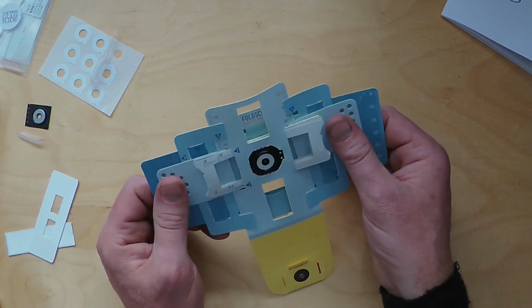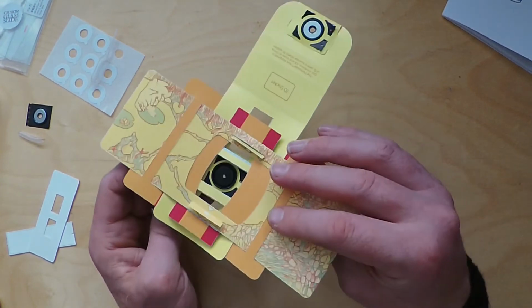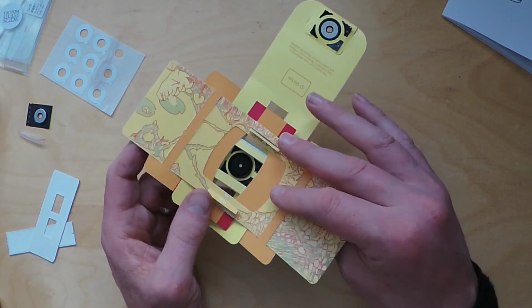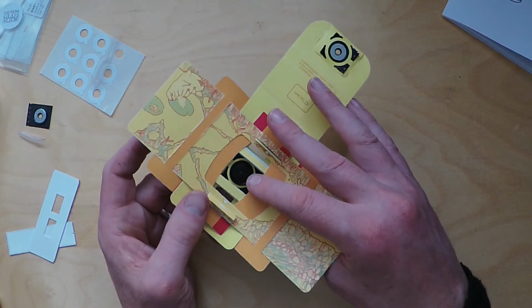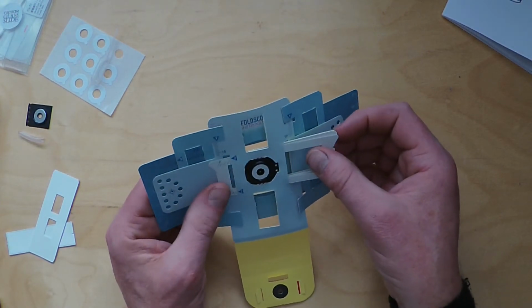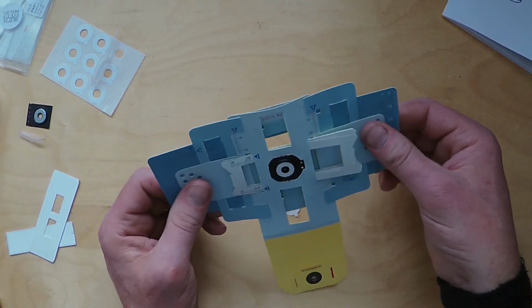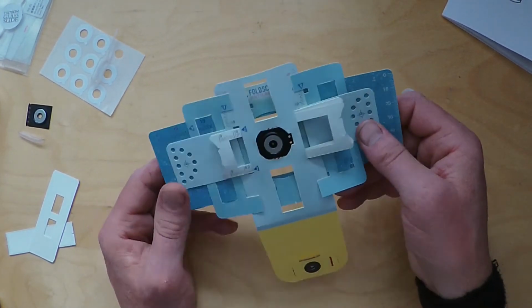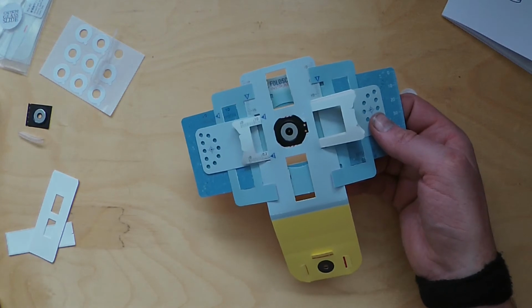But yeah, you can see the idea is that the sample is kept still there, close to the lens, depending on your focus ramp. And you'll be able to move around while keeping that bit still. It will sort of make sense shortly.